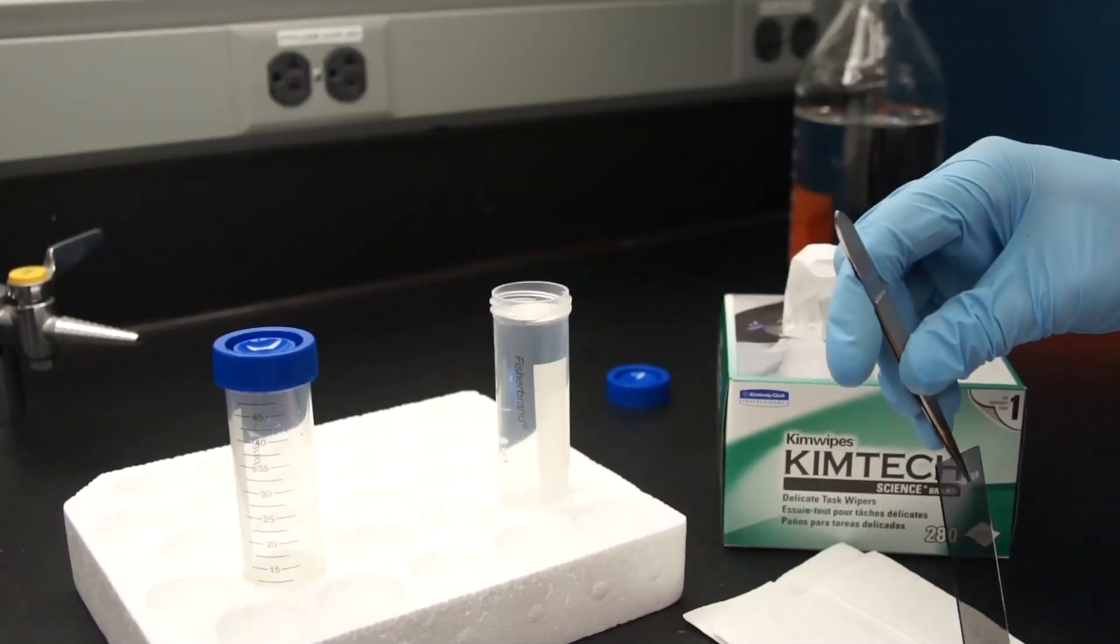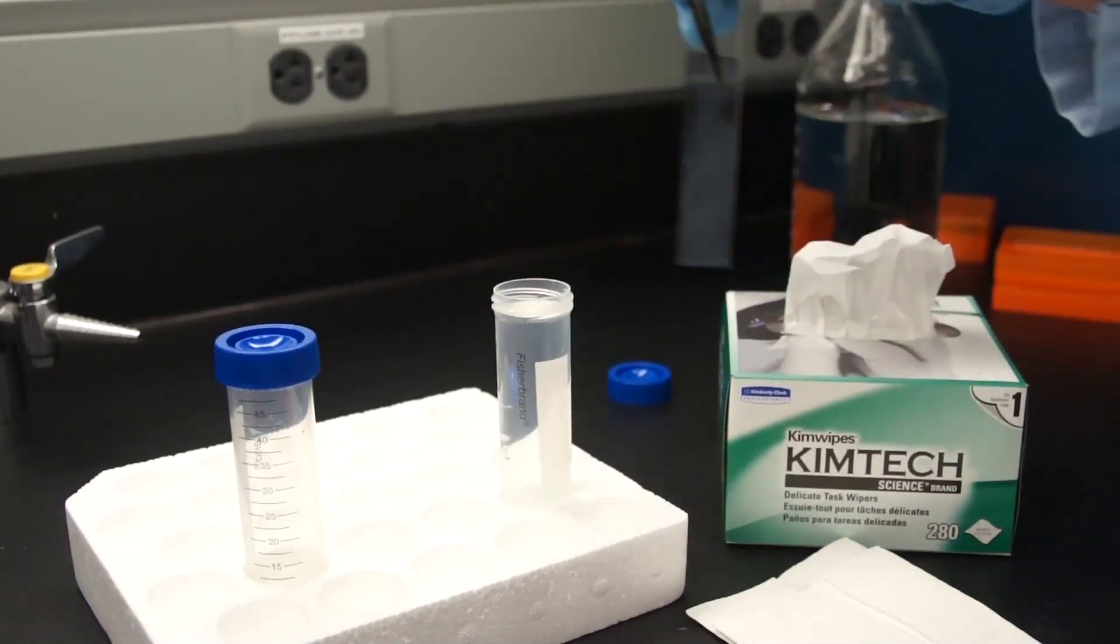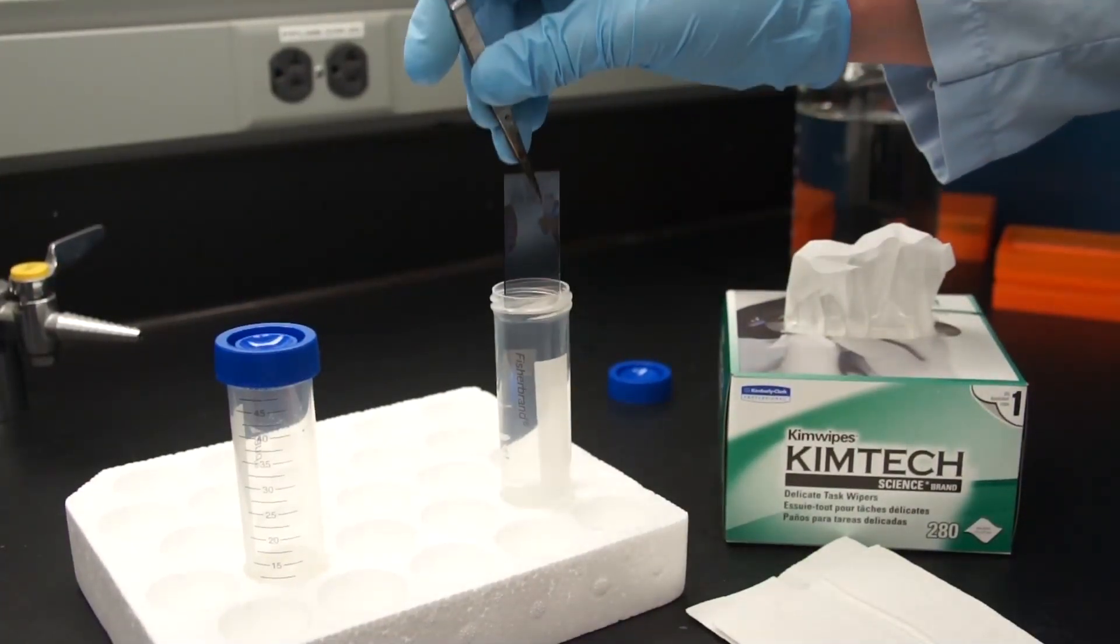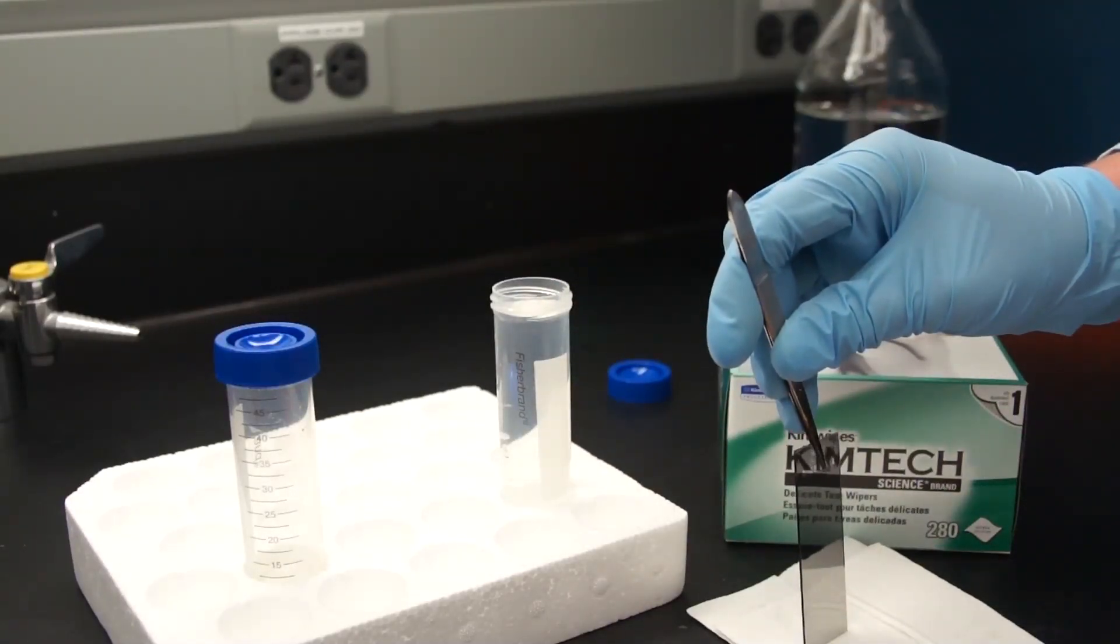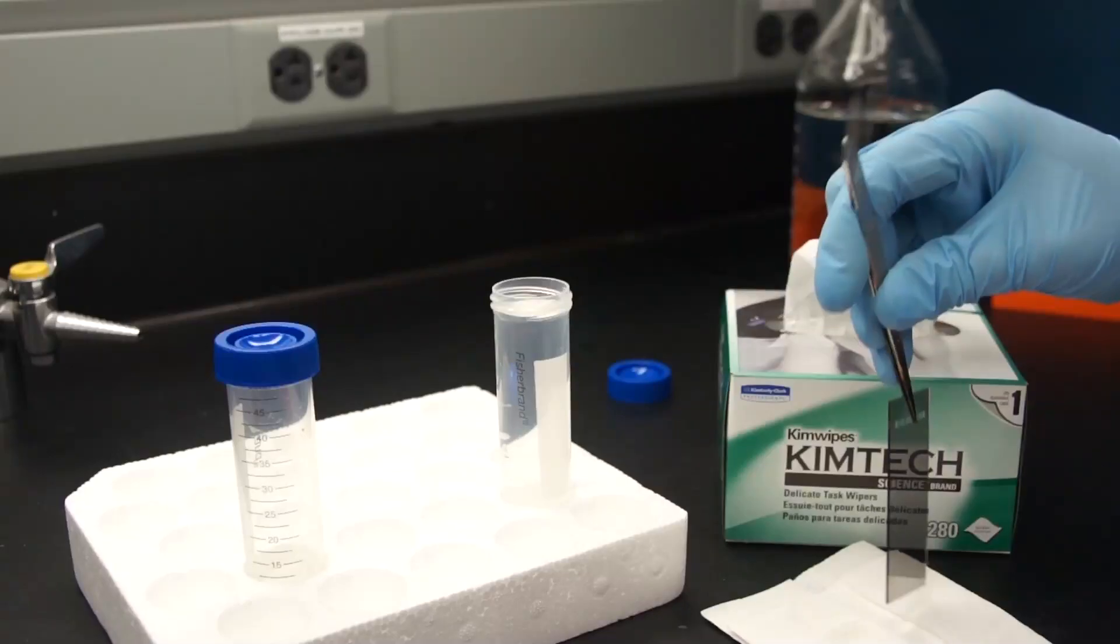Wash once by quickly dipping the slide into a 50 milliliter tube containing deionized water. Drain the excess water from your slide and set it aside.